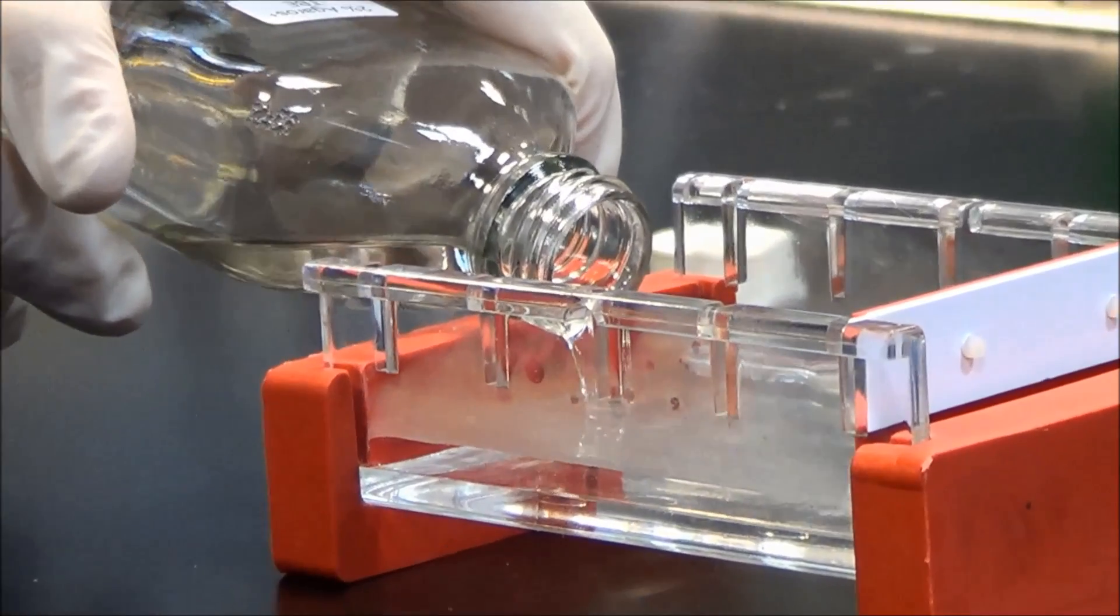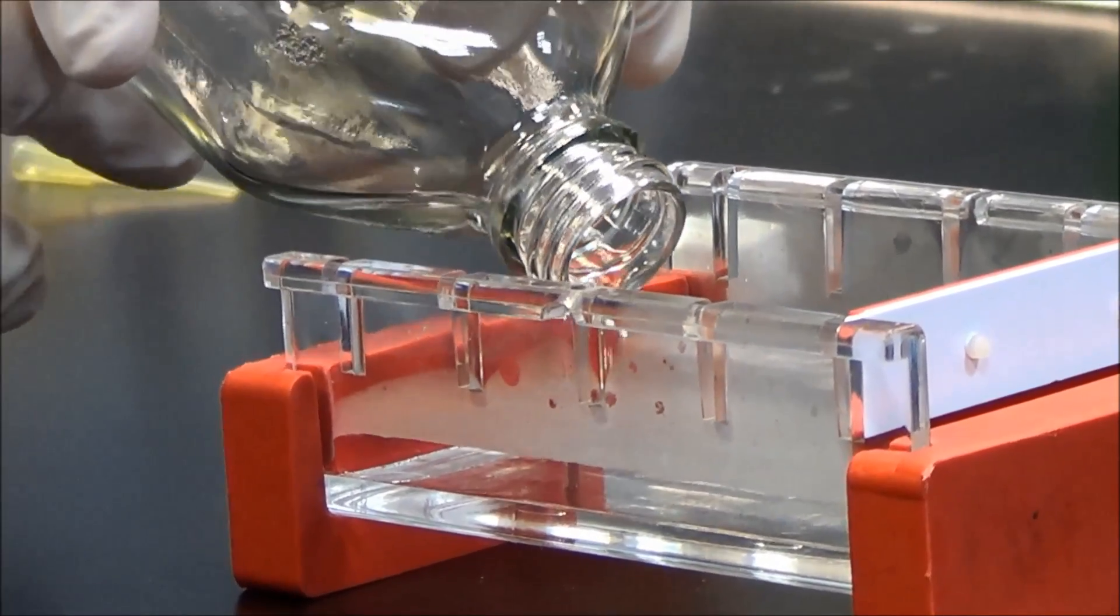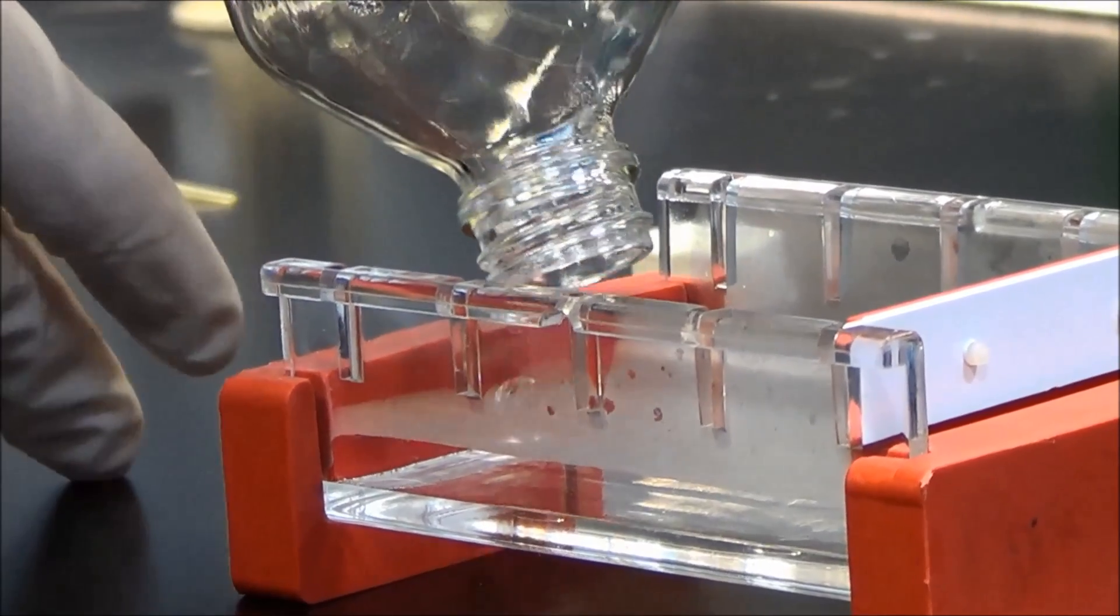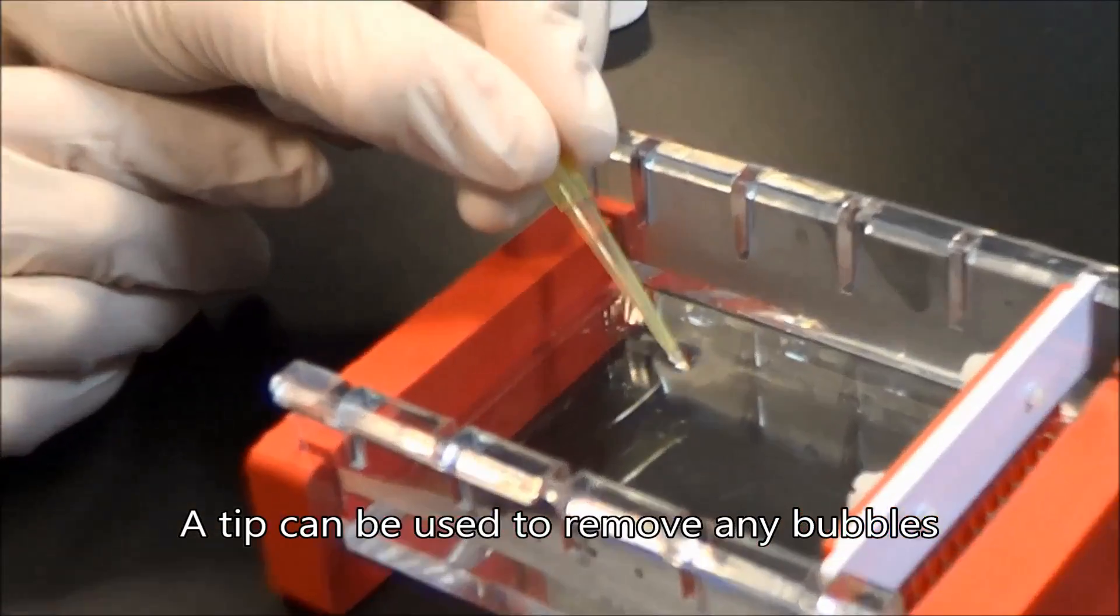Leave the gel to set at room temperature. You can remove any bubbles using a tip.